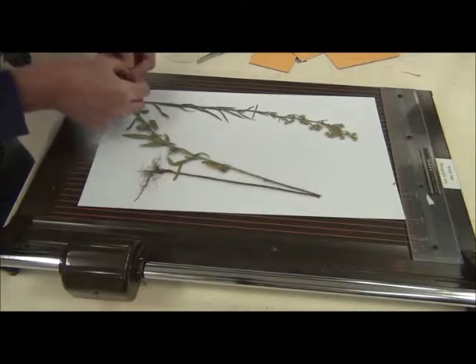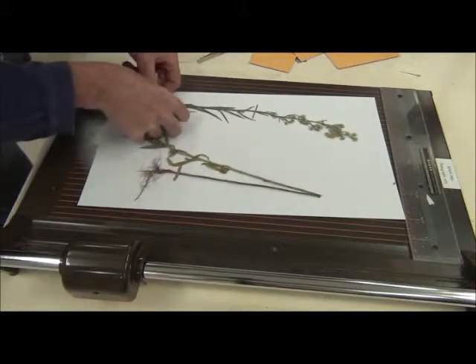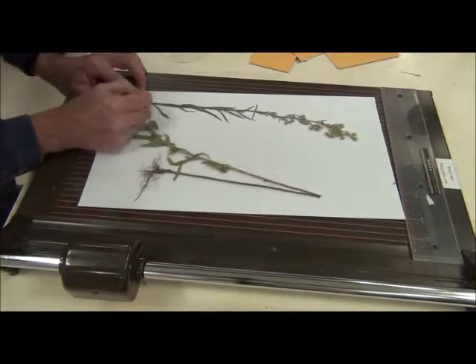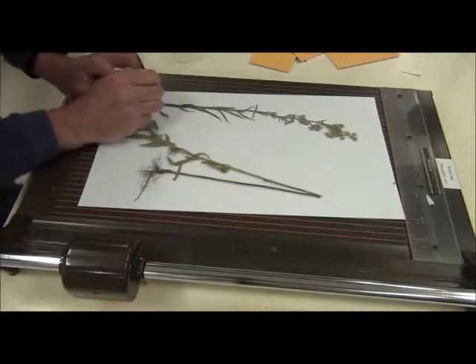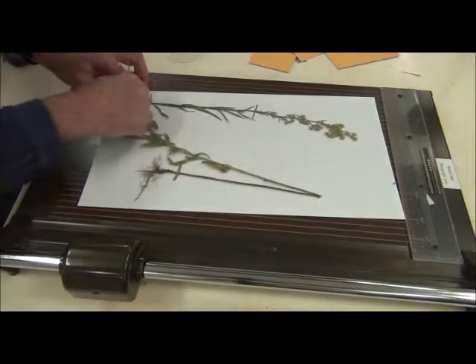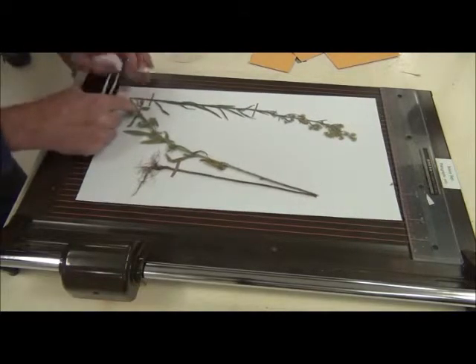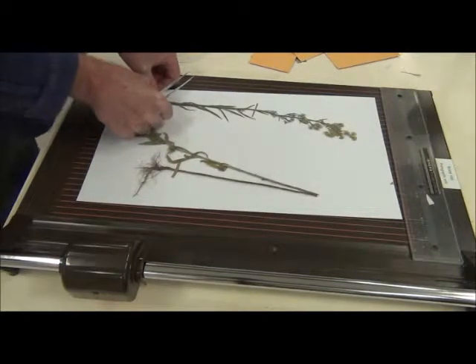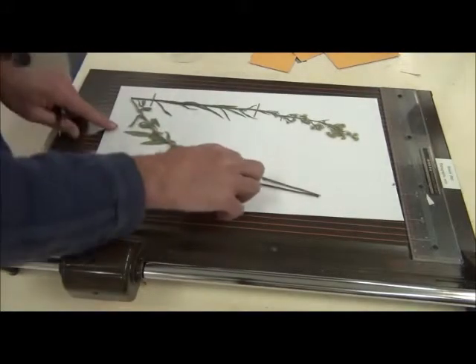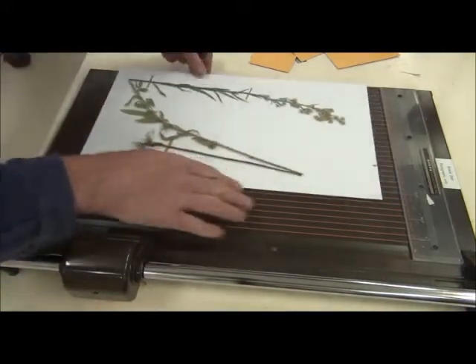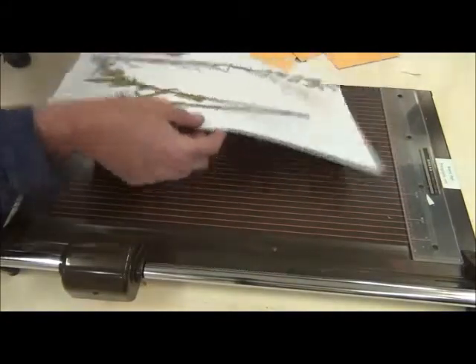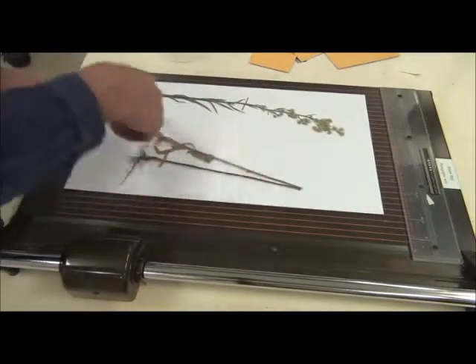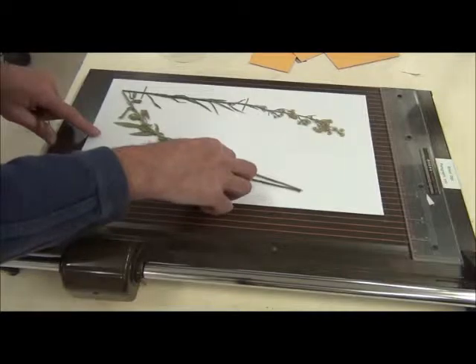Because, remember, the specimens should always be kept horizontal anyway. So, it means that it's not like you're protecting them from a tornado. You need to... Or excessive movement. And they are protected by the flimsy and by gentle handling. So, you can see there, and I'm not suggesting you try this, but you can see that that's not actually going anywhere.